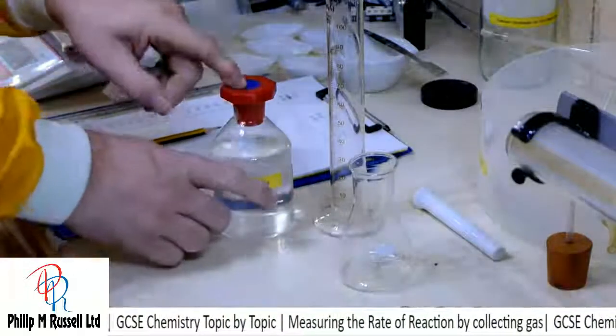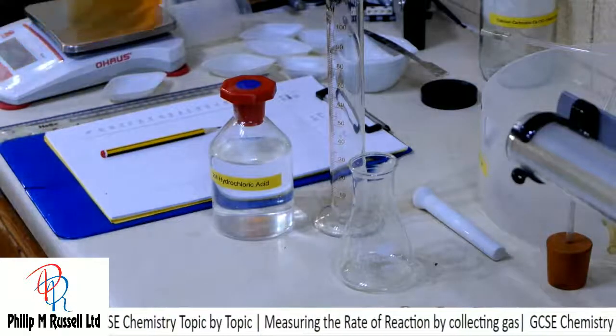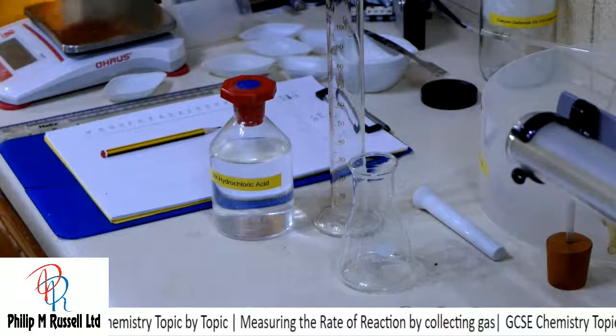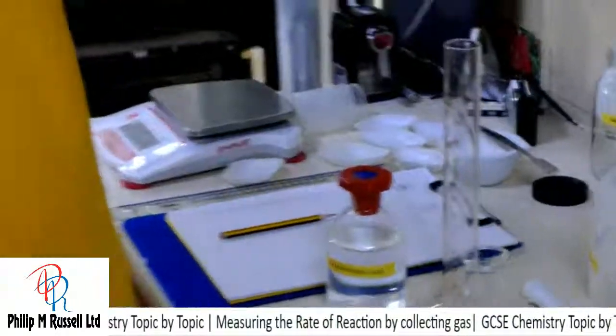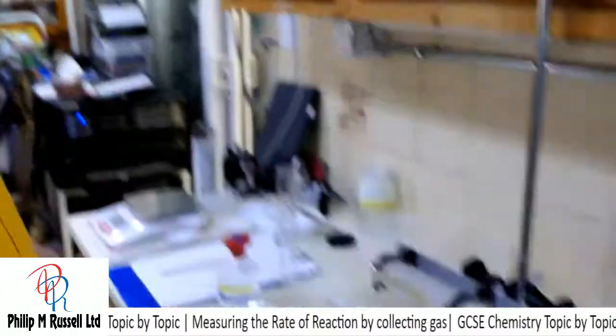So we're ready more or less to start. I'm going to play around with acid. So I'm going to put my safety specs on. And we're ready to have a go.